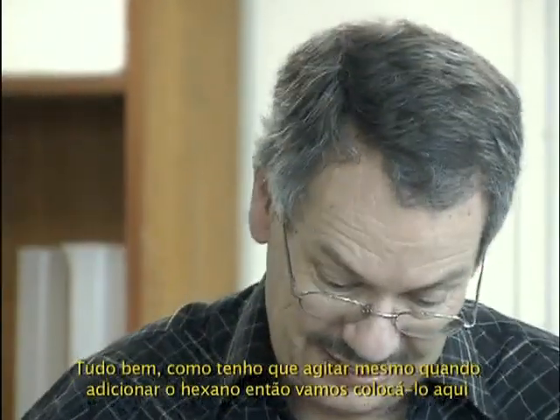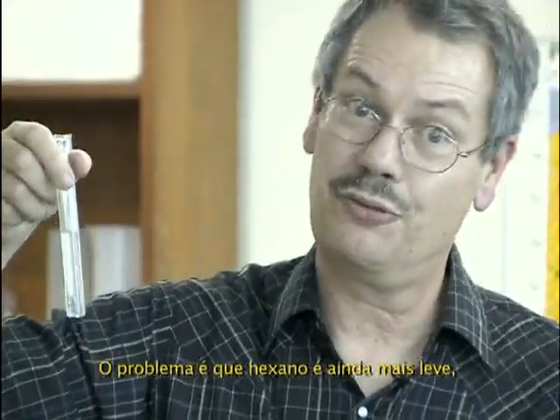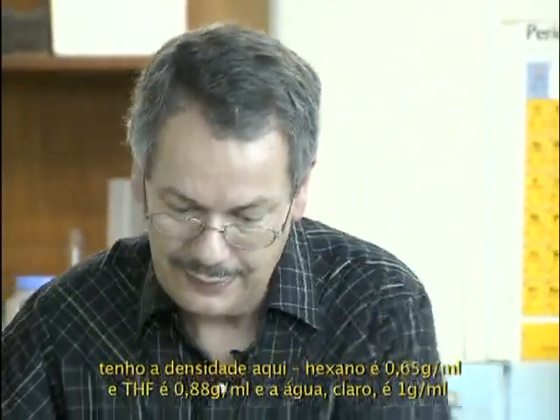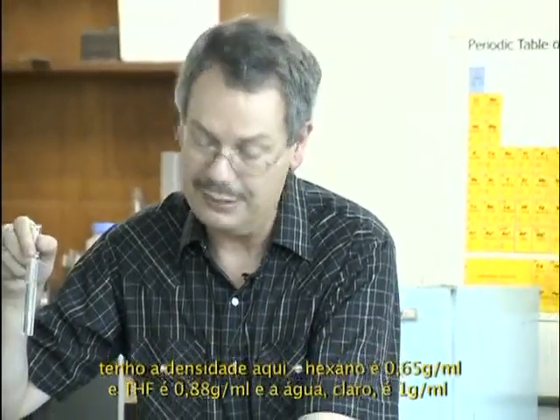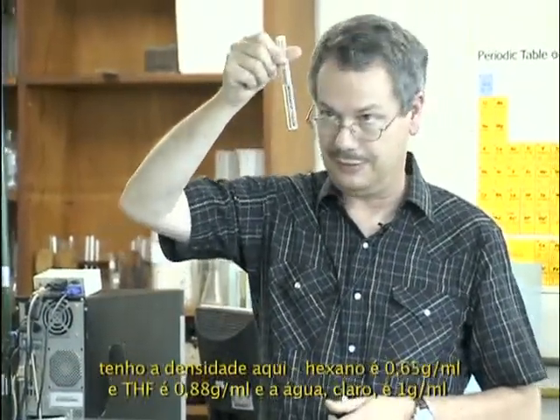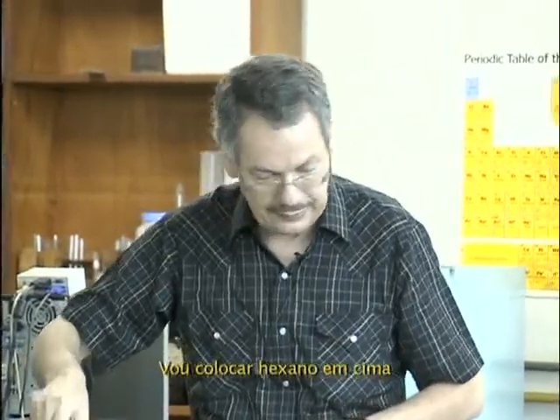That's no problem. Since I have to shake anyway when I put in hexane, I'll put hexane in this. With the problem that hexane is even lighter, I got the density from Susanna. Hexane is 0.65 gram per milliliter, THF is 0.88 gram per milliliter, and water, of course, is 1 gram per milliliter. So it doesn't matter. I will put hexane on the top. So this is water, it's done, and now I'll put hexane.